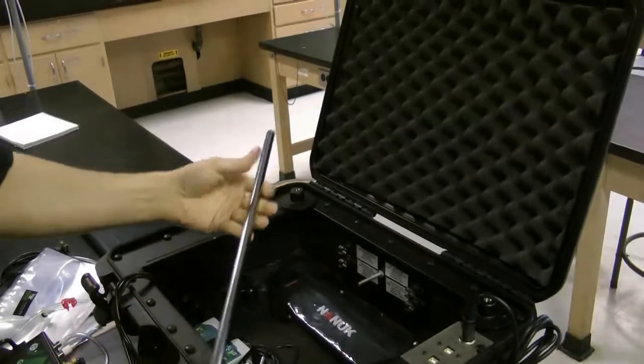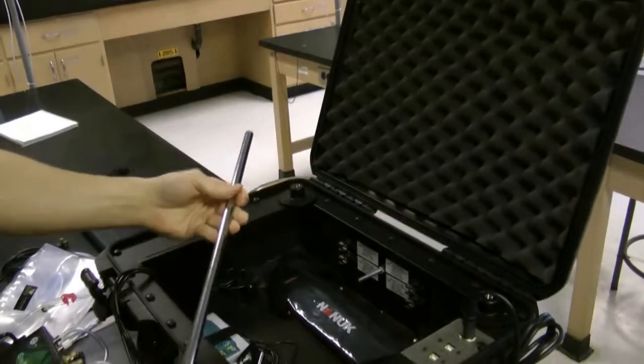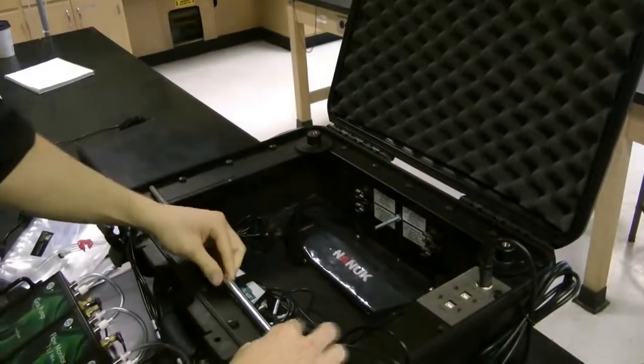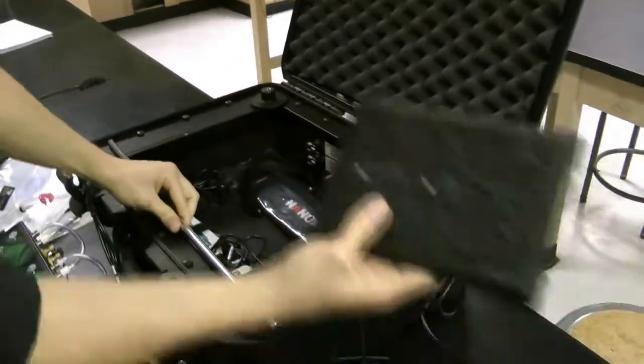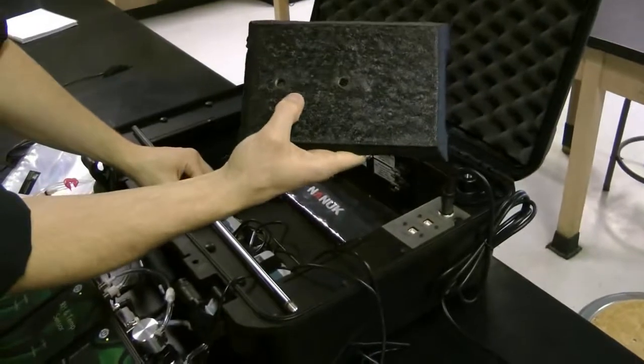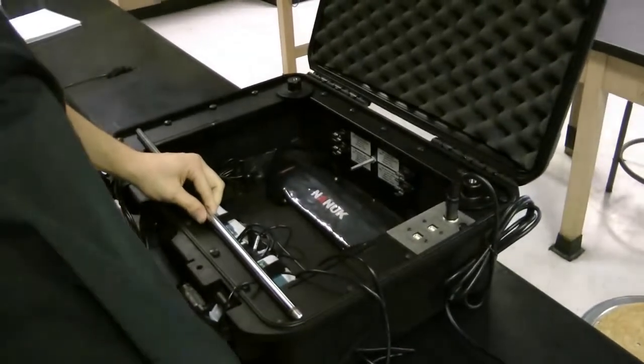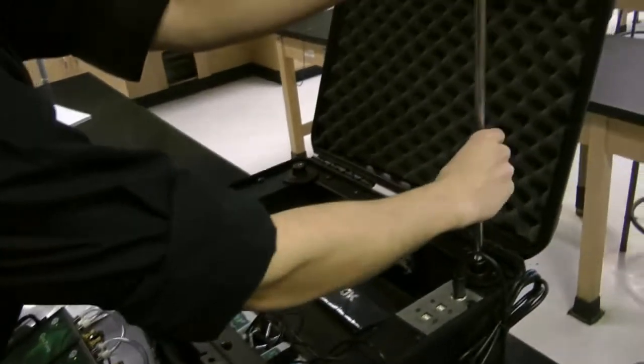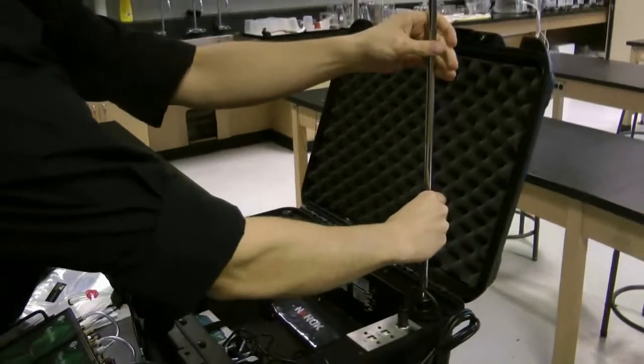Now, this stand can be connected to one of 4 places: the left or right of your QBox, and in the center or side of the stand. For now, I'll be connecting this to the right side of the QBox. Simply screw it in.